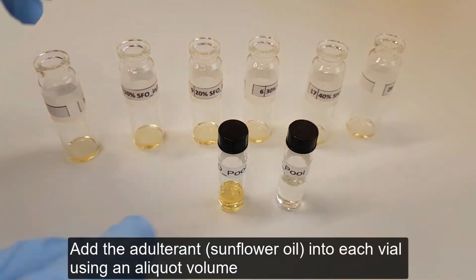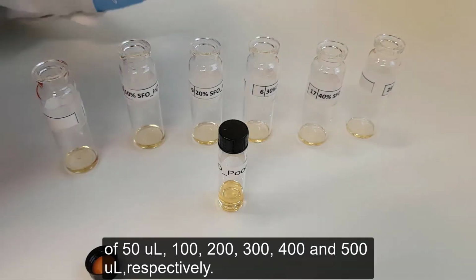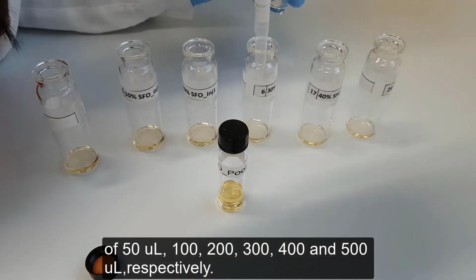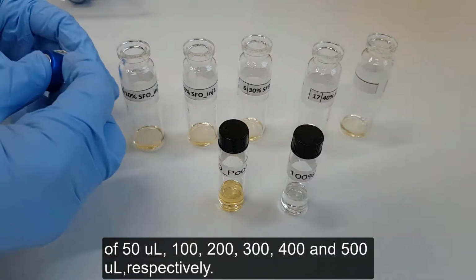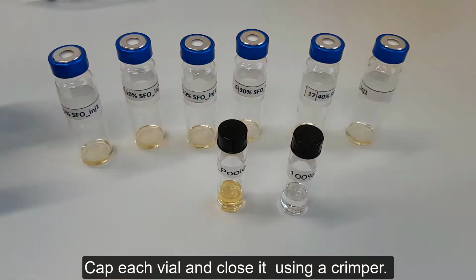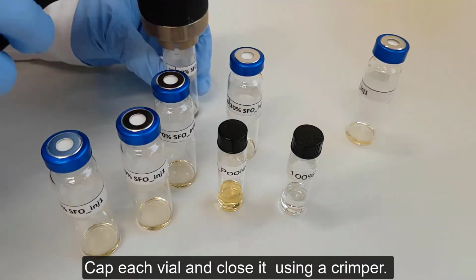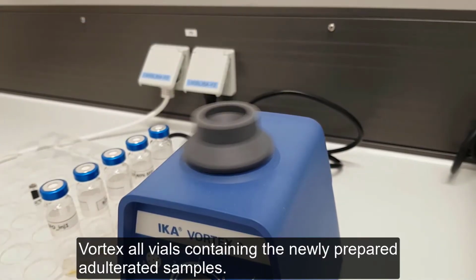Add the adulterant into each vial using an aliquot volume of 50 microliters, 100, 200, 300, 400, and 500 microliters respectively. Cap each vial and close it using a crimper. Vortex all vials containing the newly prepared adulterated samples.